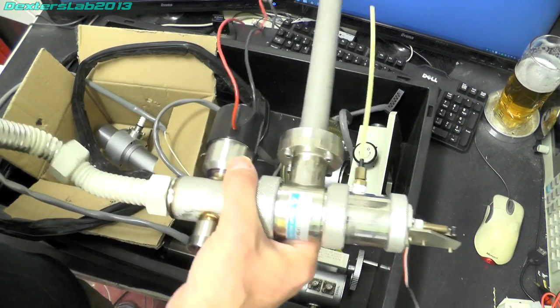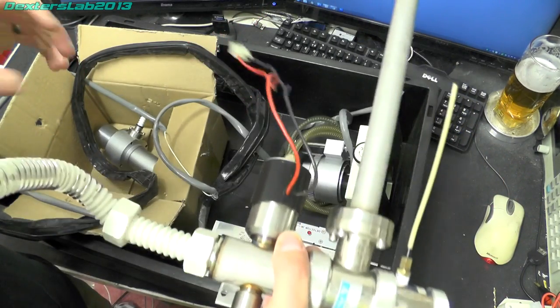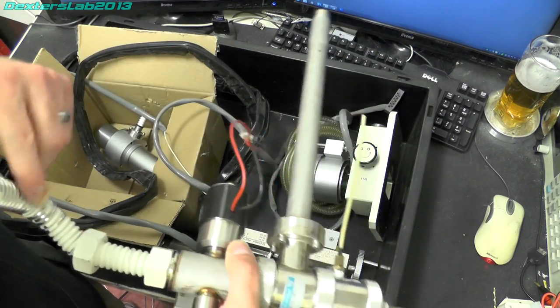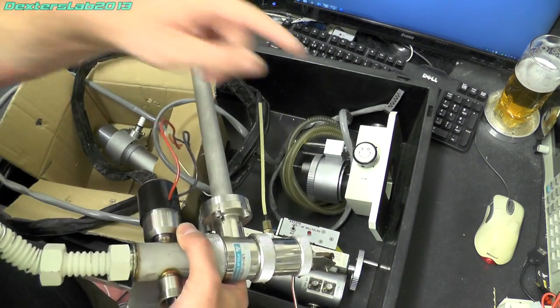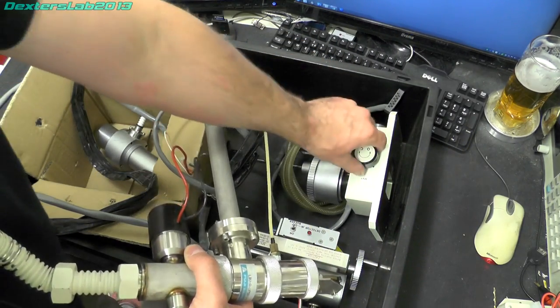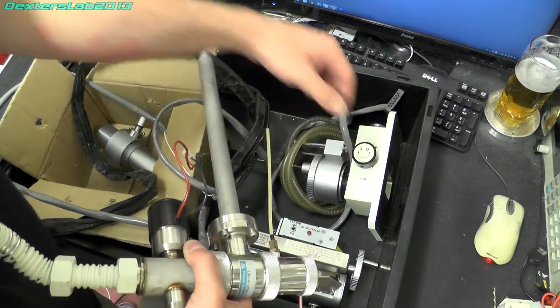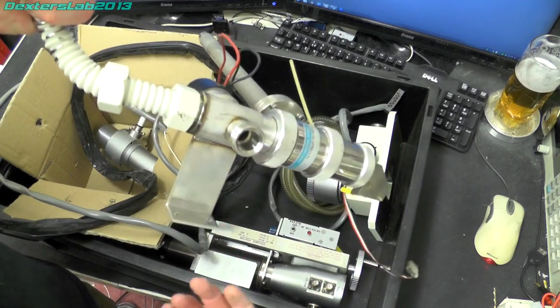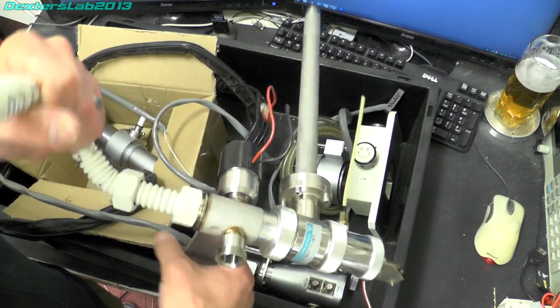So I saved that anyway because again this guy who has another system doesn't have the airlock arrangement so I pulled all this out and saved that for him.